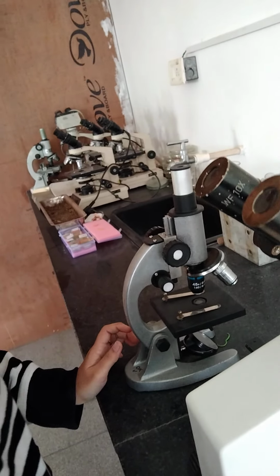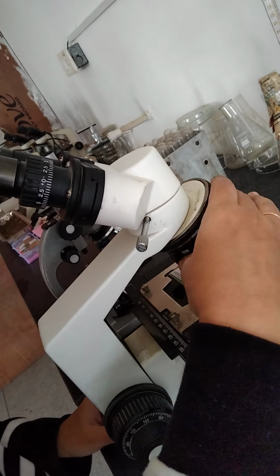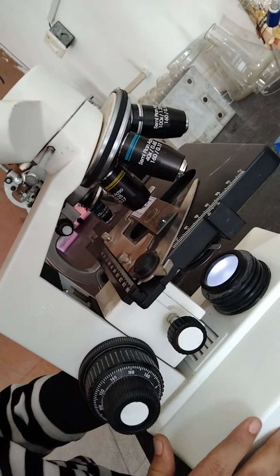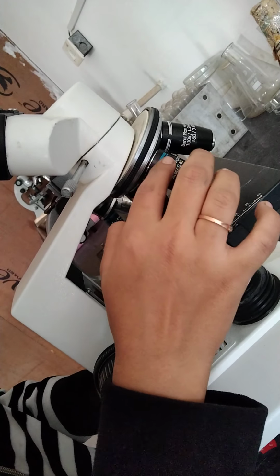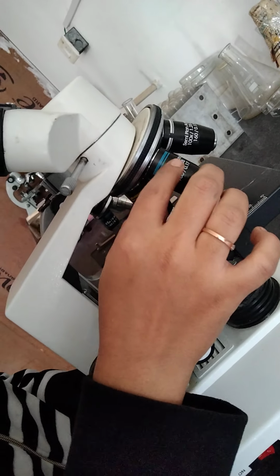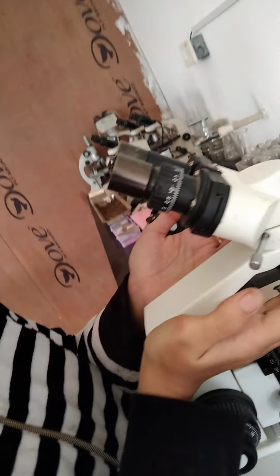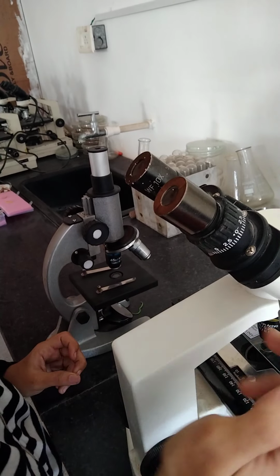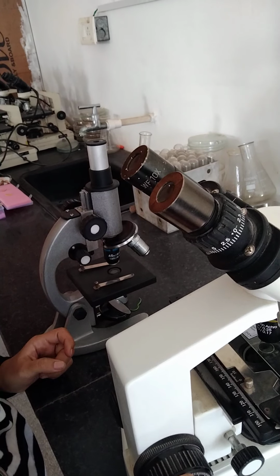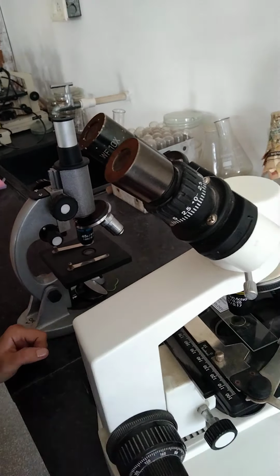Okay, then nose piece and objectives. This is the nose piece, or you can say this is the revolving disc. It is just to select which magnification you want, right? These are the objectives. You can say this is a small system of lenses, primarily the magnifying mechanism. Primary magnification is done by the objective lens, and whatever image is formed will be further magnified by this eyepiece. So together you can say the total magnification of the microscope is done by both the objective as well as the eyepiece. Exactly.